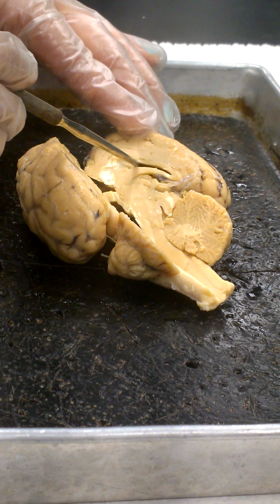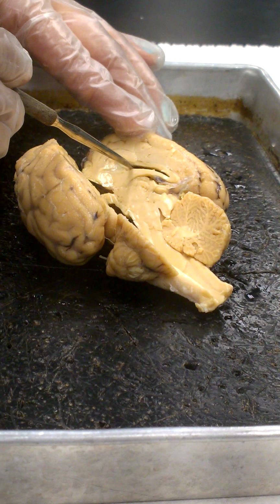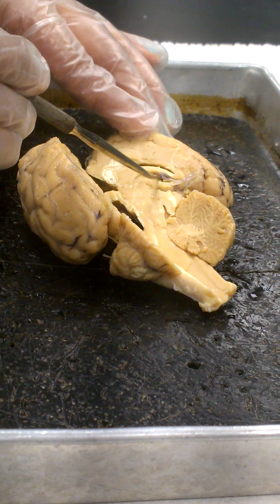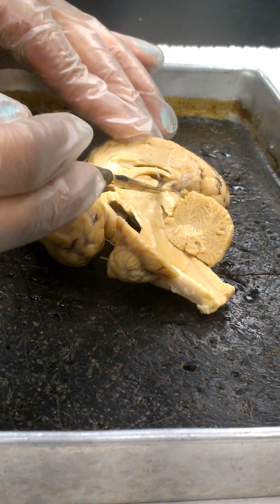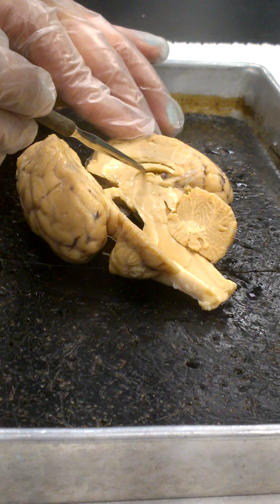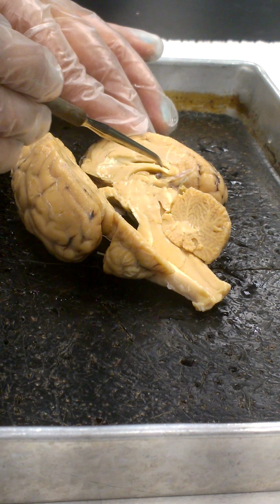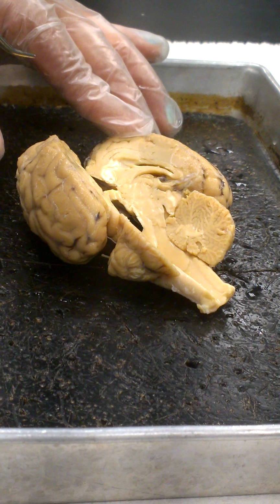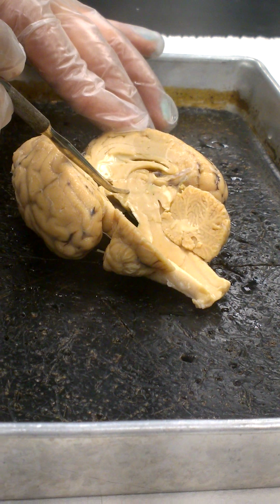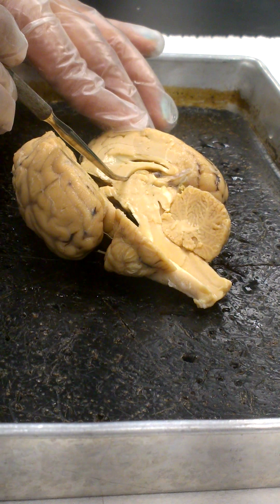The third ventricle then would be a region below this, which if I pull this apart a little bit in here, we can see some of this brownish material is actually within that other ventricle. So there's another cavity or another space right there where the probe is running. We've actually sectioned through the third ventricle, right through the center of it. So we have half of it in this hemisphere and the other half of it's over there. So it actually comes down and actually surrounds this entire region. This large structure here passes right through the center of that third ventricle.